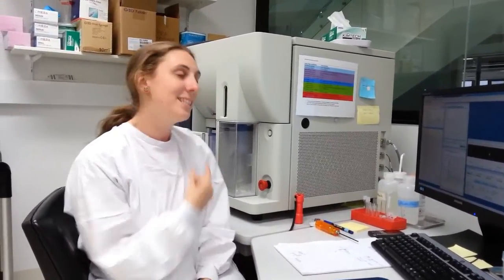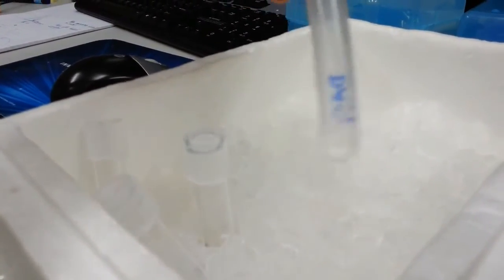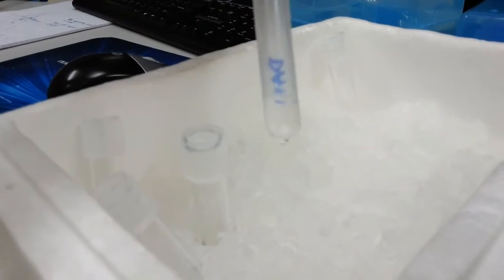The small machine that I usually use is out of action today, so I get to use the big fancy machine. So these are my little tubes of cells, and each little tube has about a million cells in it. Right, so let's measure our first sample.